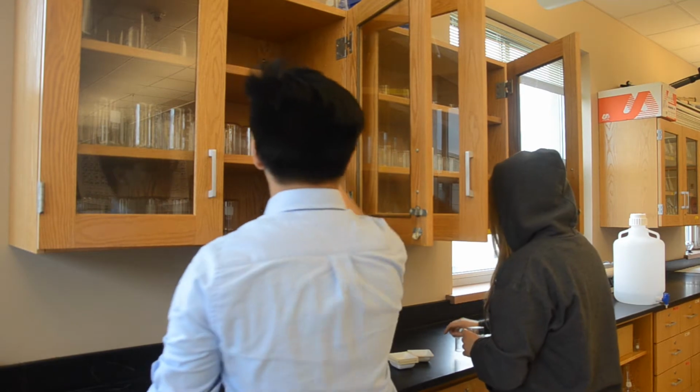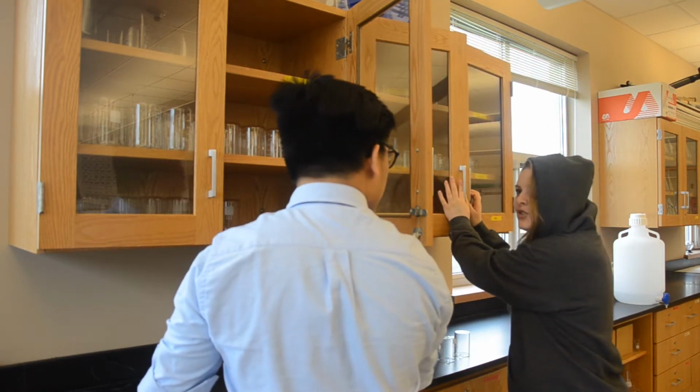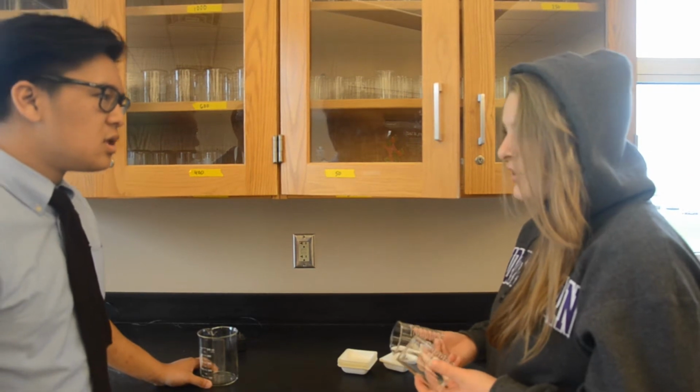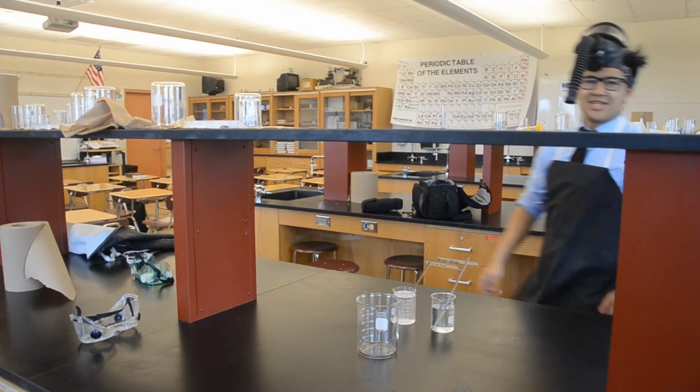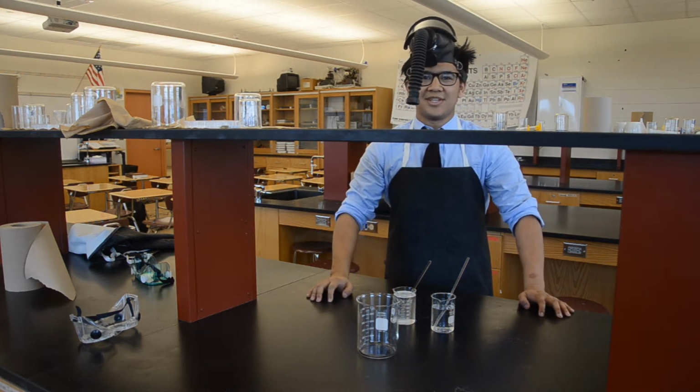Jesse, we're gonna need beakers, flasks, a weighing scale, a gas mask, that one too. But Mr. White, what does all this stuff have to do with what we're doing? Jesse, it's easy. With this sodium carbonate and calcium chloride, we can easily create a precipitate. What?